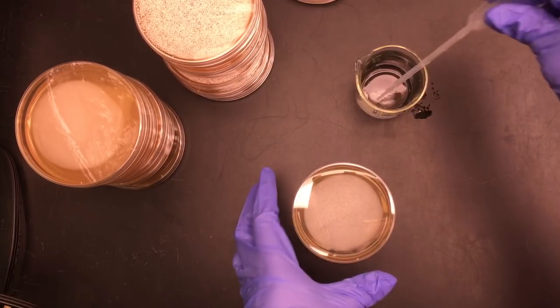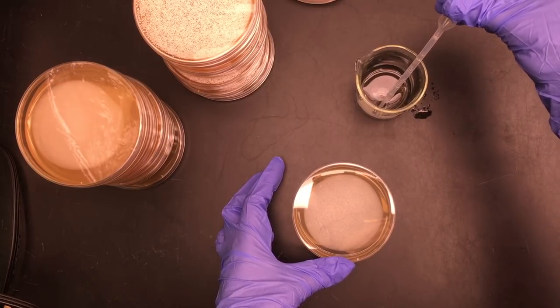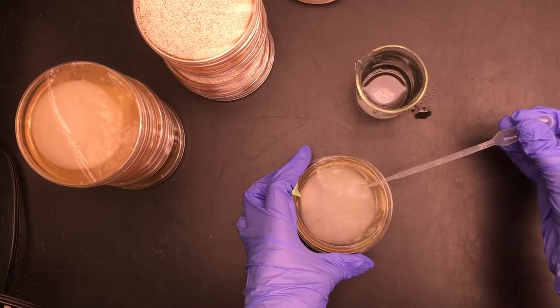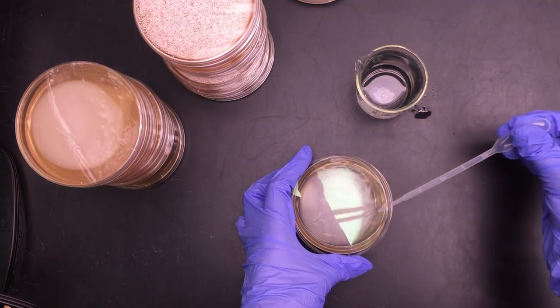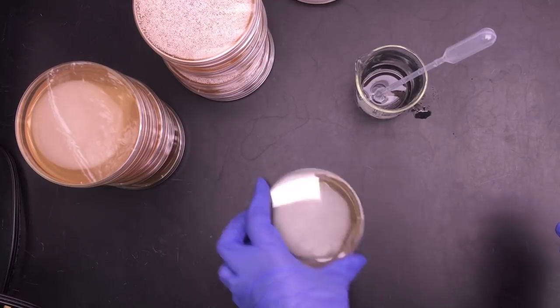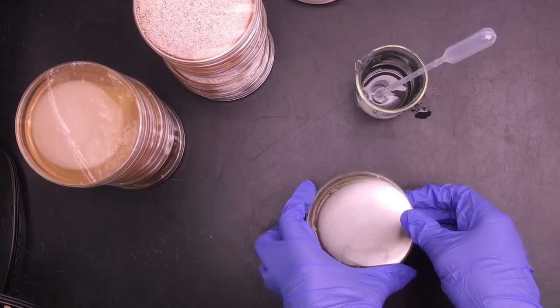And so now I'm going to take my pipette. This is a new sterile pipette. And I filled it up to a milliliter here and I'm going to inoculate in here. I'm going to swirl it around to cover the agar. Make sure my water is covering all of the agar.